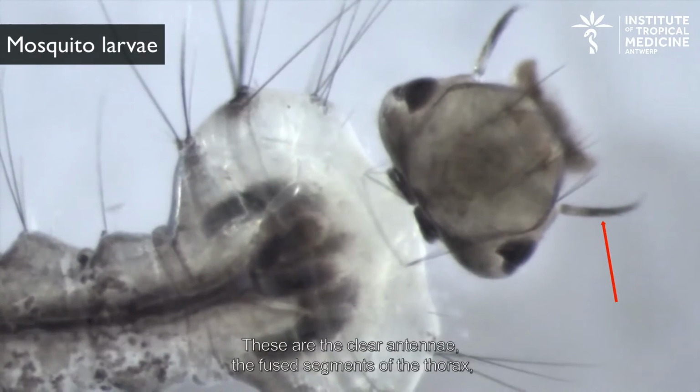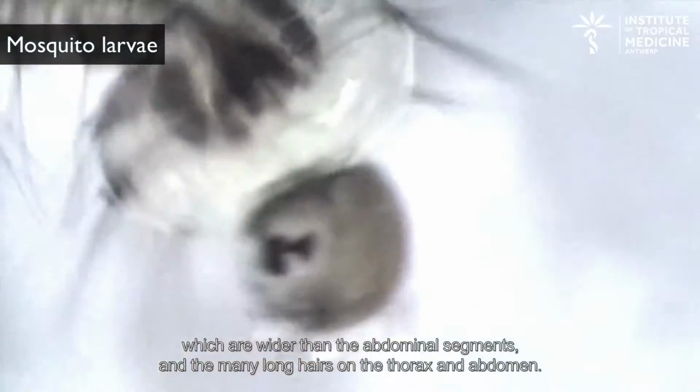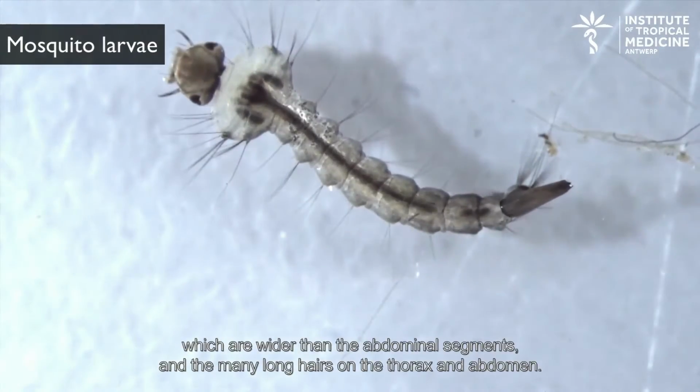These are the clear antennae, the fused segments of the thorax, which are wider than the abdominal segments, and the many long hairs on the thorax and abdomen.